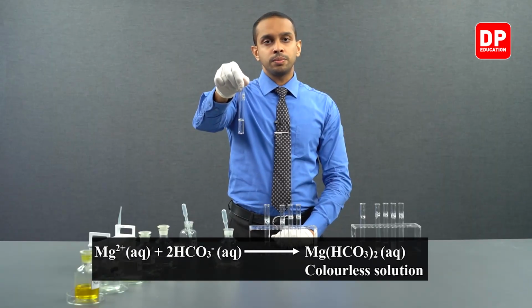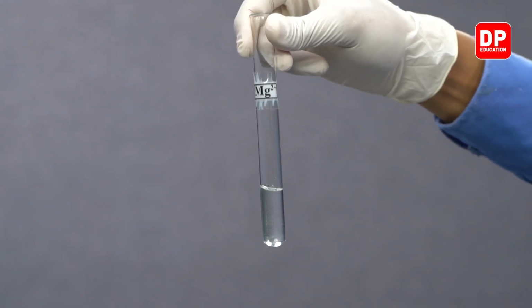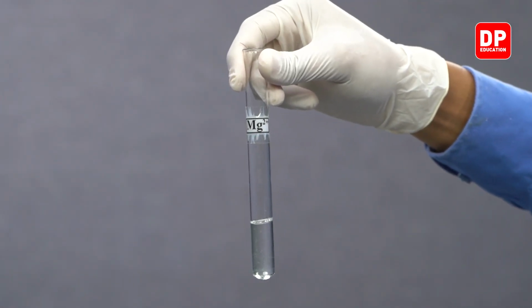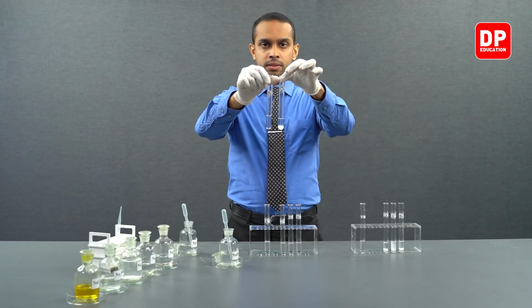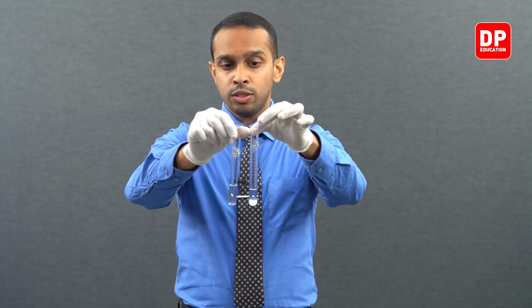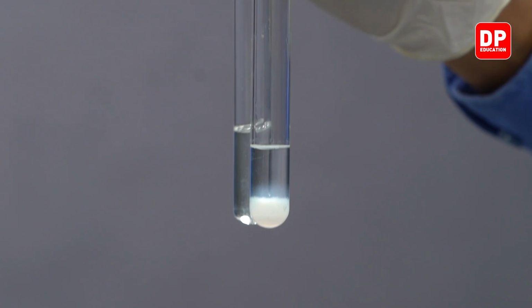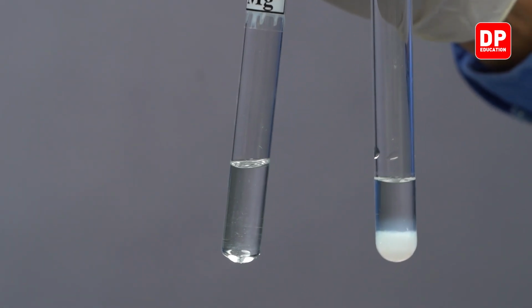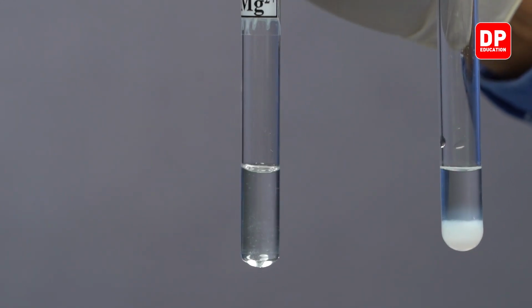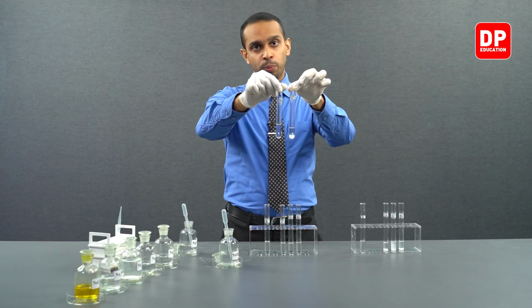What is the observation? Do you see the formation of a white color precipitate? No. In the previous situation, when we added the carbonate anion to magnesium 2 plus, we saw the formation of a white color precipitate. But we will not see the formation of a white color precipitate when we add bicarbonate into magnesium 2 plus aqueous ion solution.